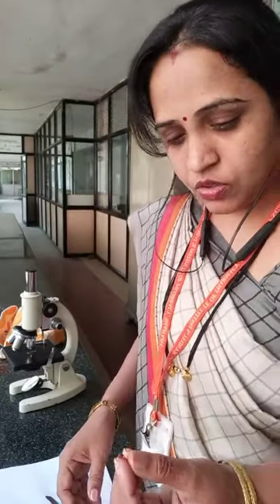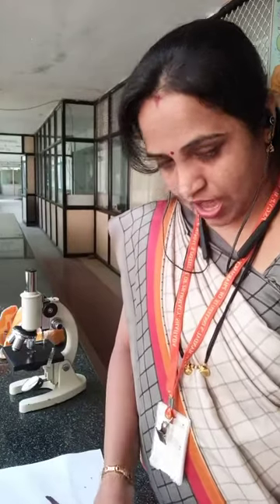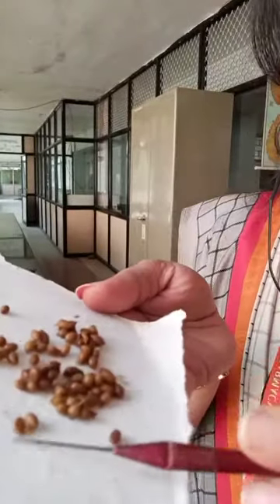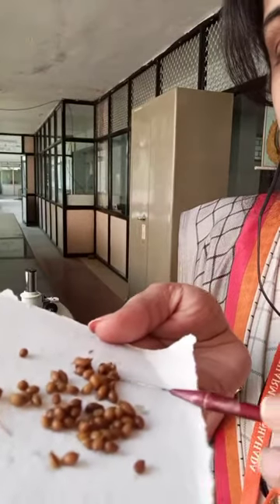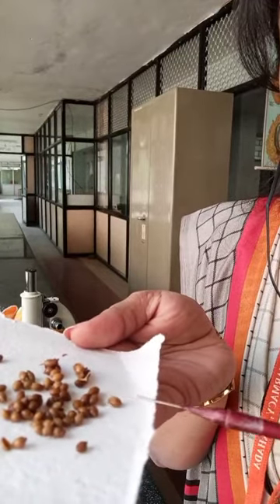These are coriander fruits — very, very small fruits. Coriander's biological source consists of dried ripe fruits of Coriandrum sativum, belonging to the family Apiaceae (Umbelliferae). It is an Apiaceae fruit.